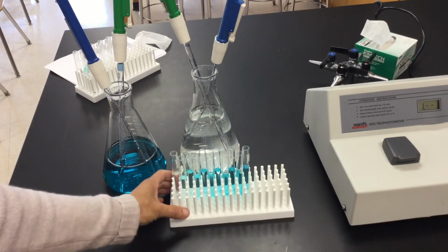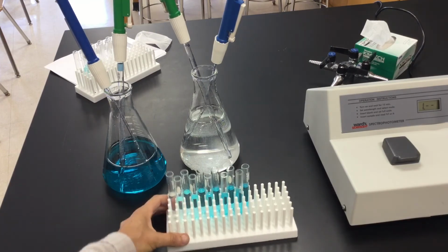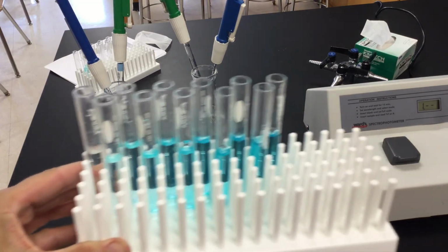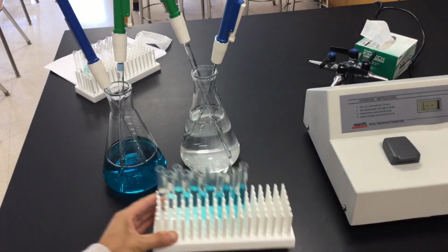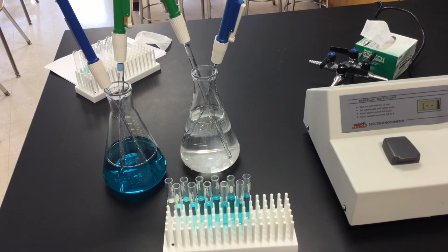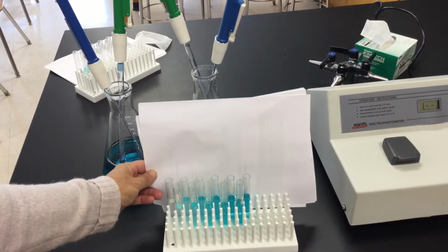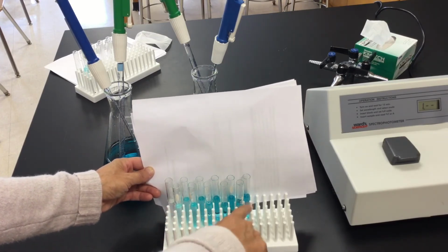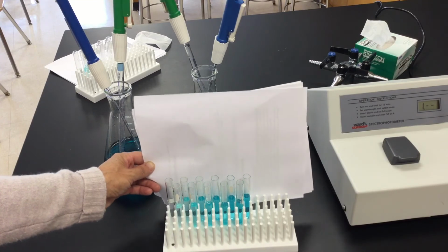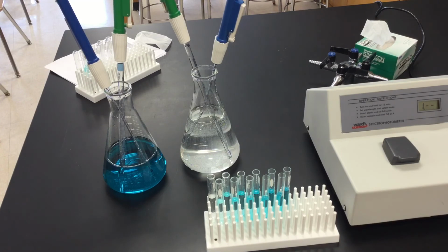What you should notice, and this is one of the biggest things I don't see within the classroom, is all my tubes should be equal all the way through, meaning they're all the same amount. Here it looks a little different because of the angle of my camera, but they are all the same amount. The next thing you should notice, it's a little hard to see, I'm going to see if I can pop some white behind this, is that you should have an increasing color, because remember, they're getting stronger in terms of their molarity. They have more and more copper sulfate as you go all the way to tube number 11, which you do see. So this is what I'm utilizing for part 3 once they have those 11 tubes created.